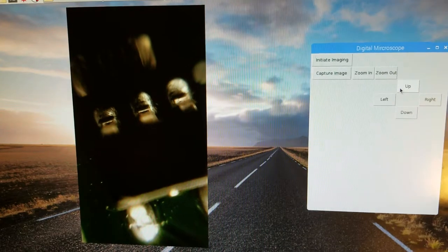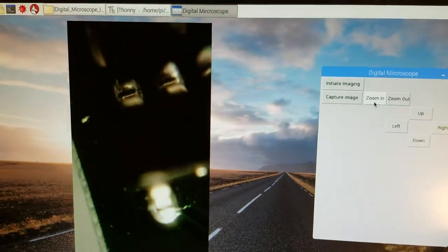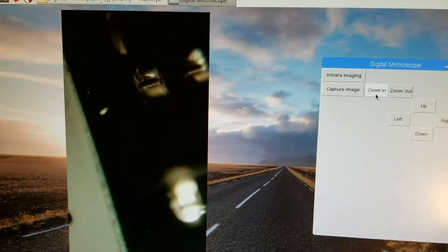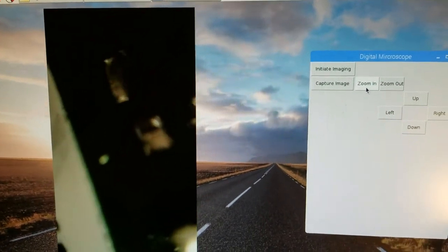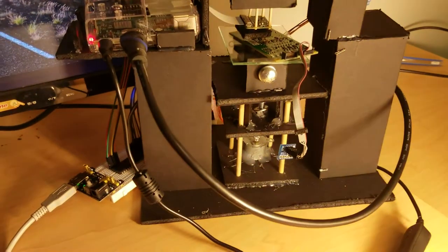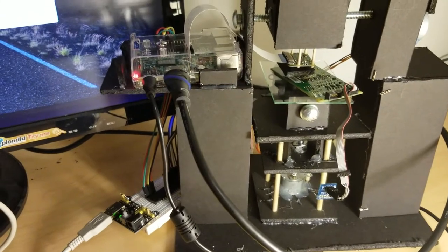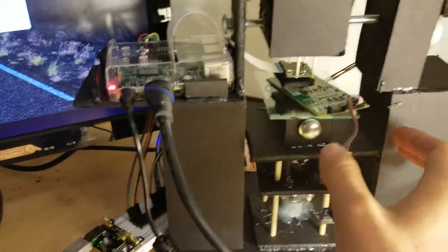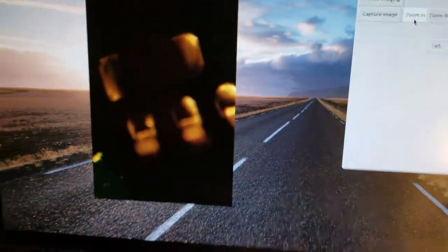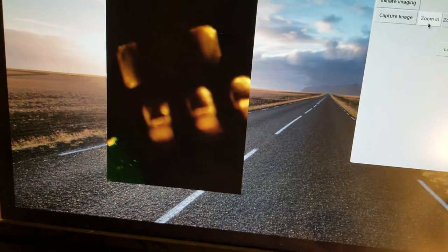So we can hit zoom in. And as you can see, we seem to deviate a little from where we're at. That's due to the construction. It's not perfect yet. The rails aren't perfectly moving it just up and down. You'll notice there is some slight play here. This is why we get that movement as we go up and down. But it does work, and it does allow us to zoom in and zoom out.